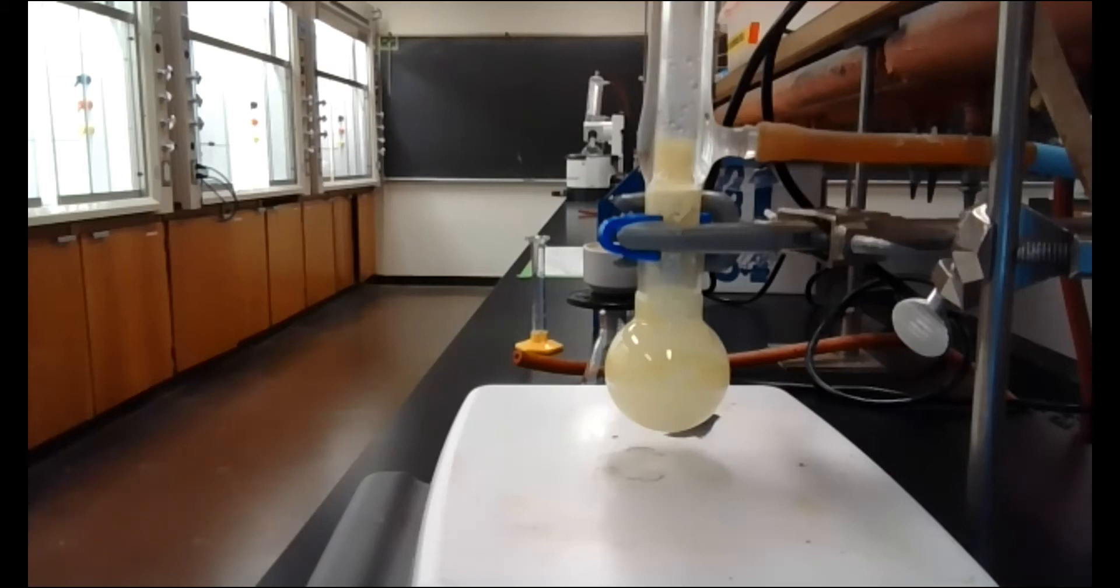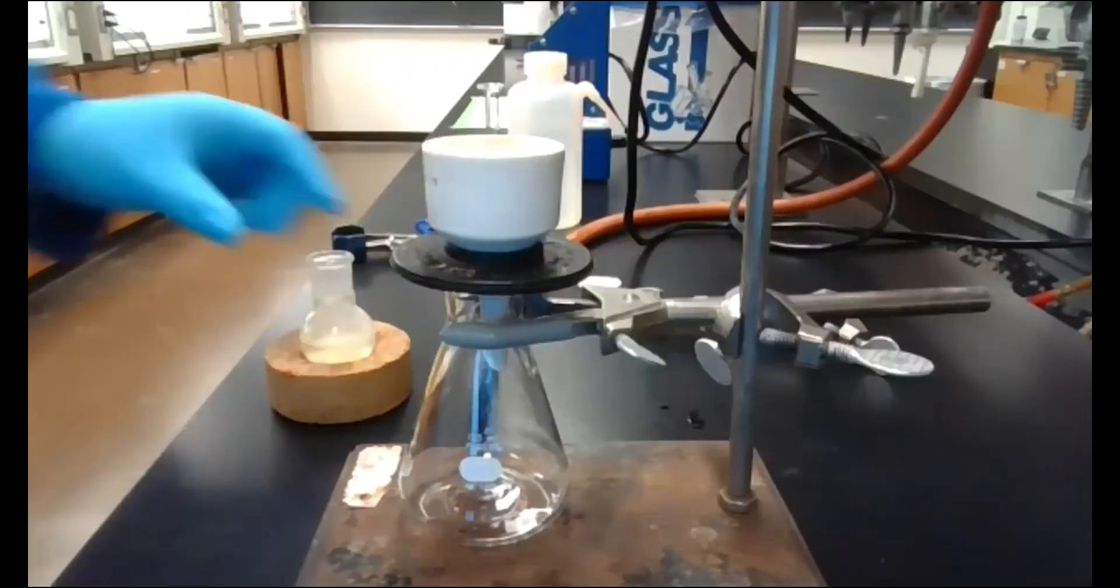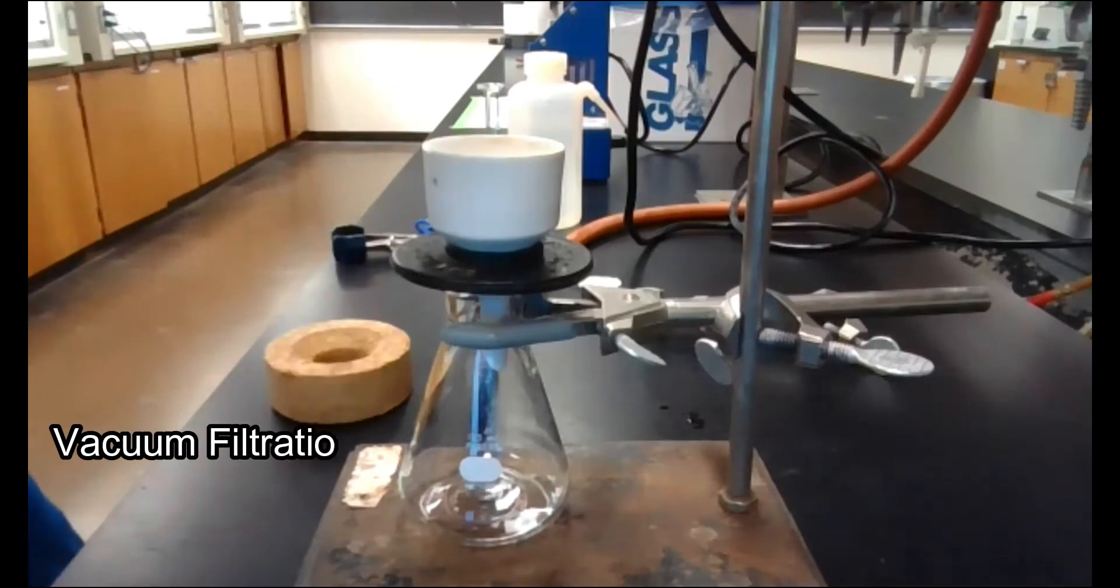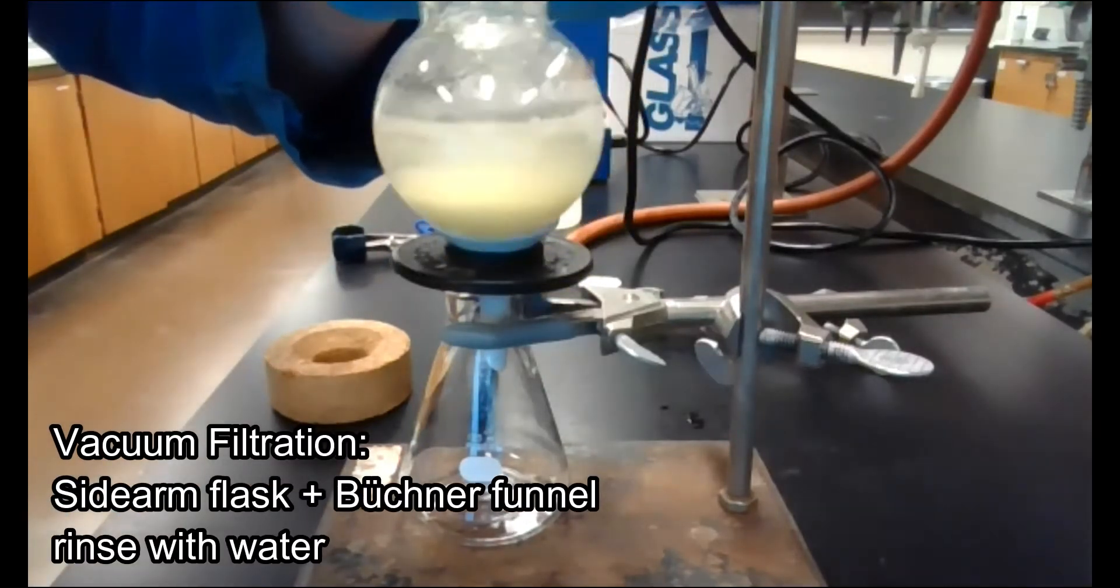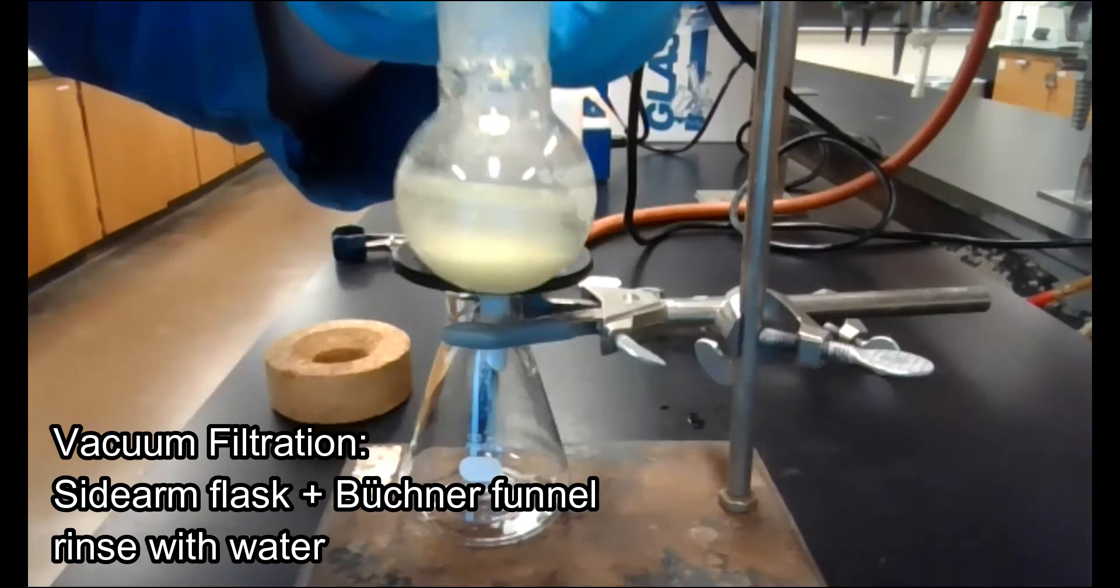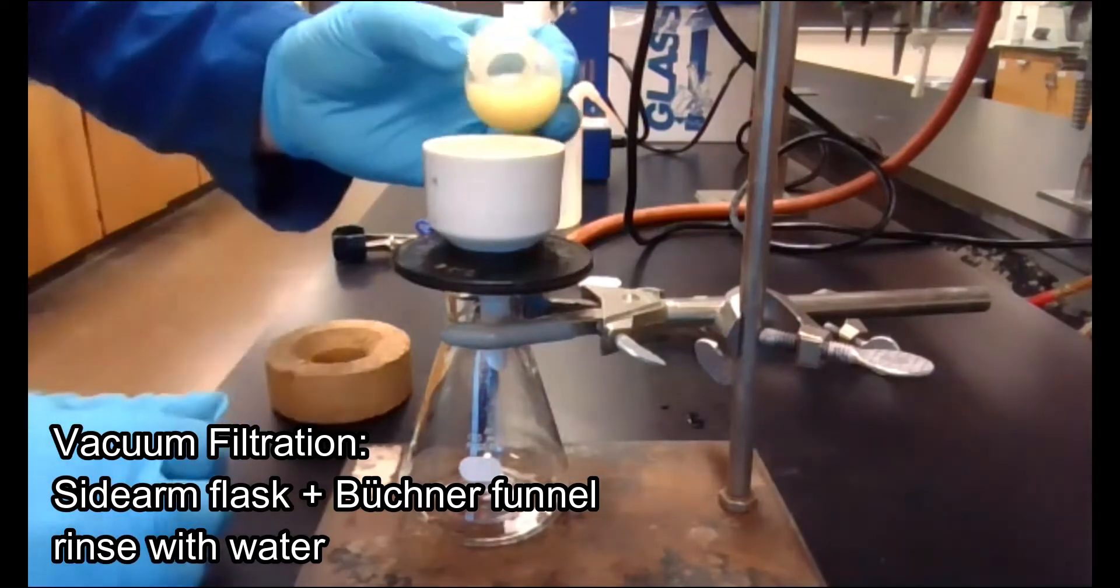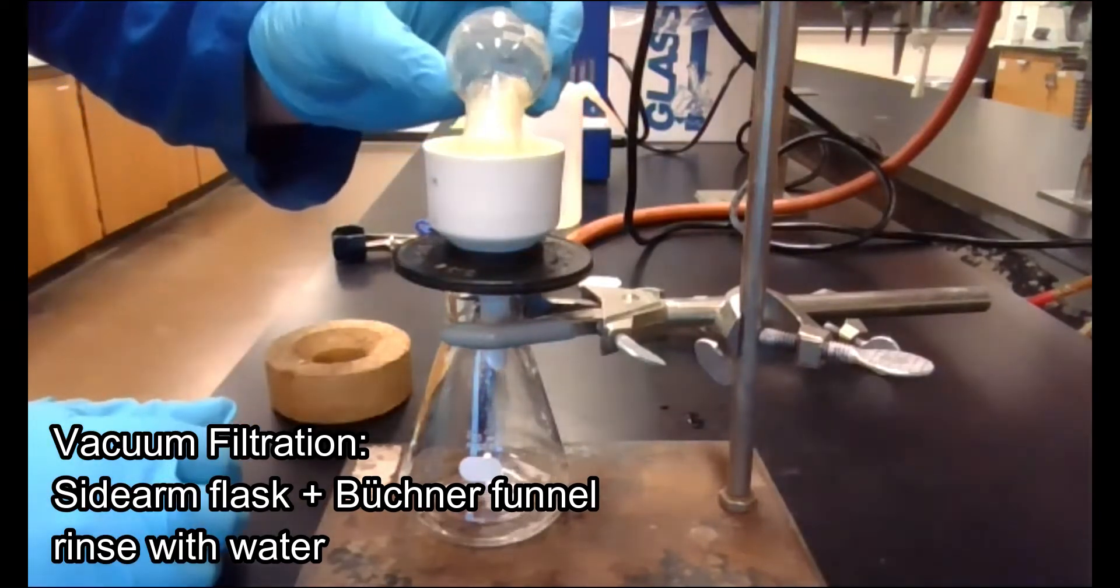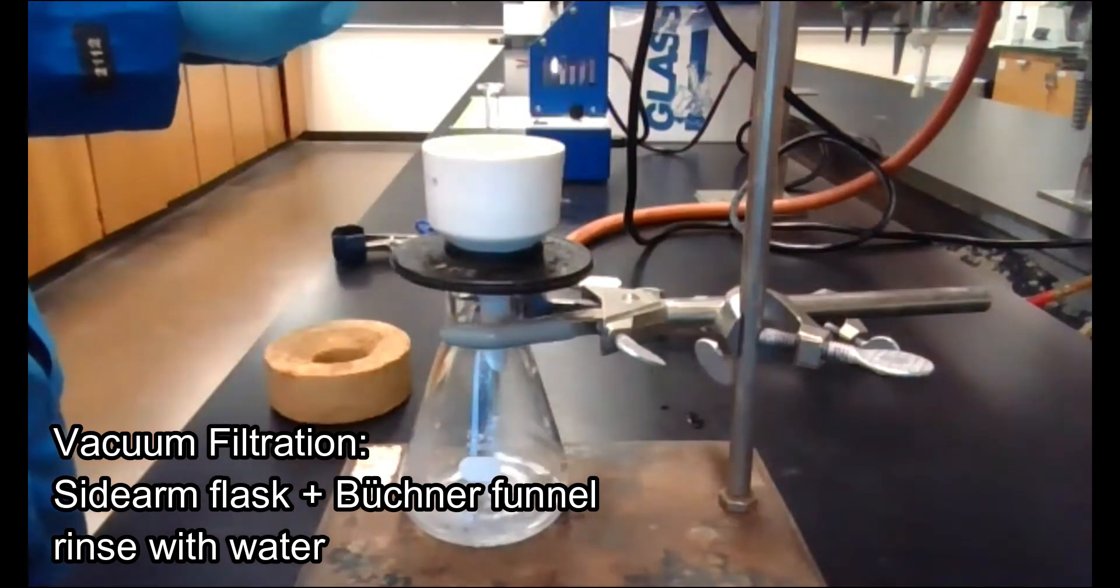All right, so the reaction has cooled down to room temperature, and see here, a solid suspended in the water, and we're going to go ahead and vacuum filter that, which I have set up right here, and we're going to rinse this with a couple mils of some water I had cooled down earlier.